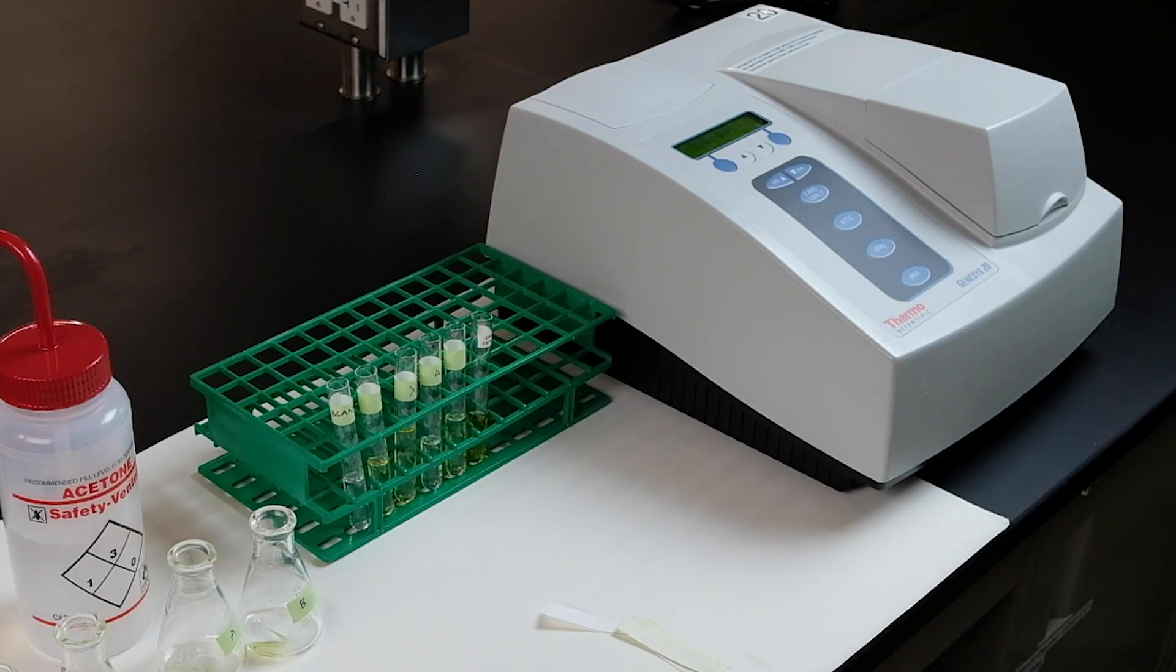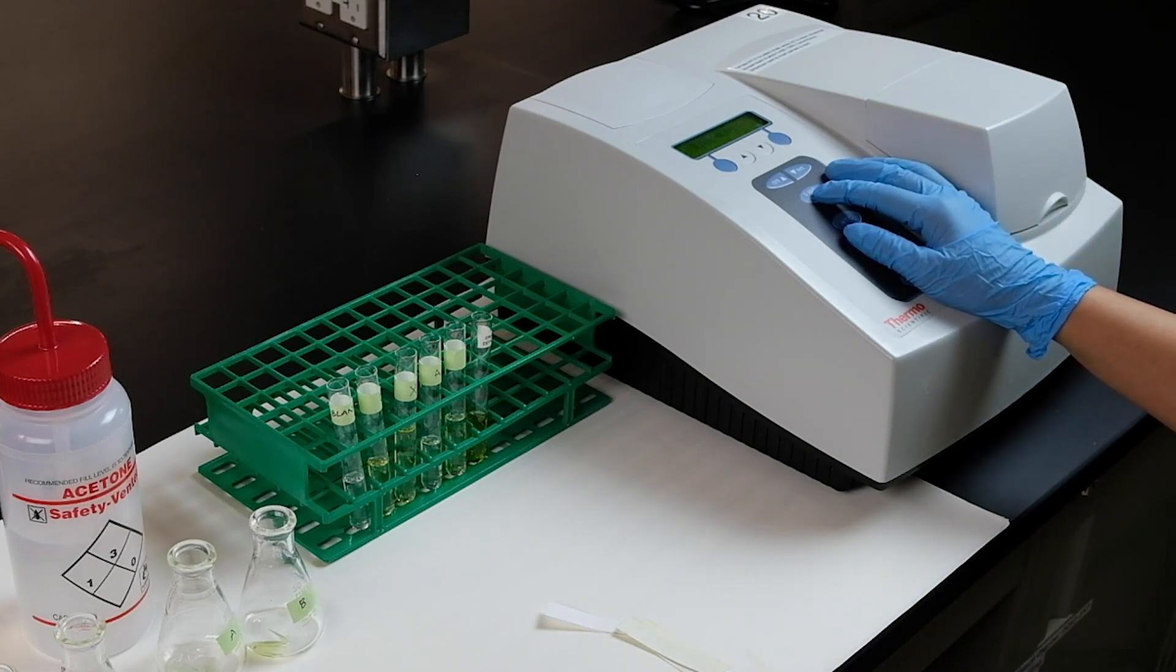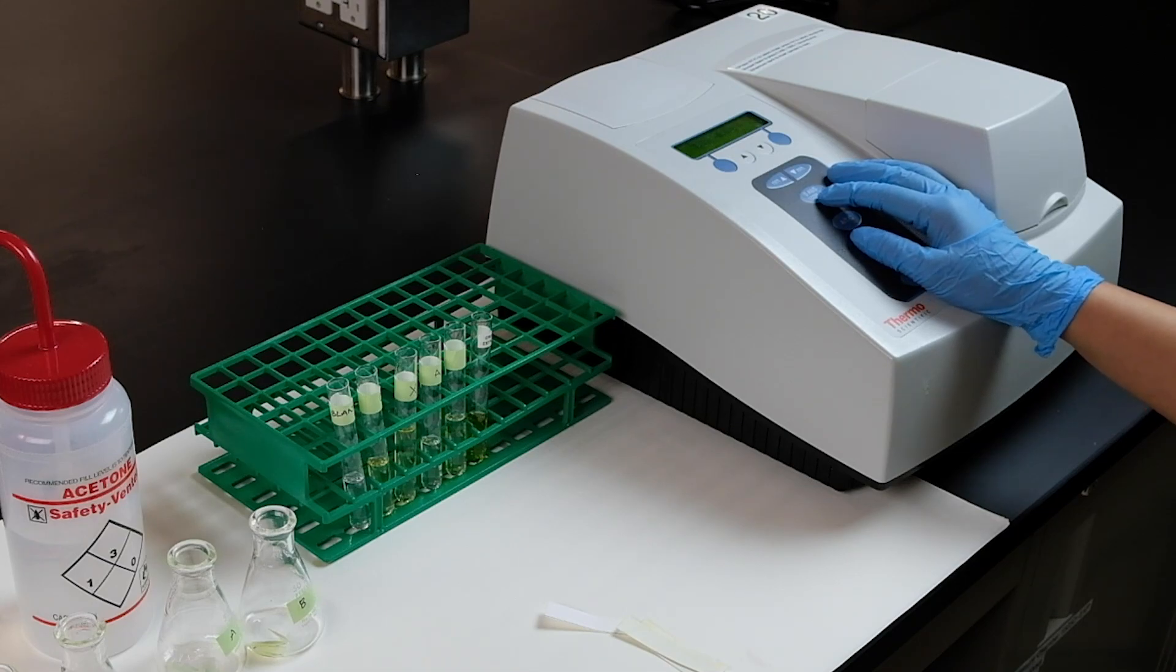Repeat the series with an increment of 10 nanometers until you've finished all the wavelengths and report the values in the table provided in your lab manual.